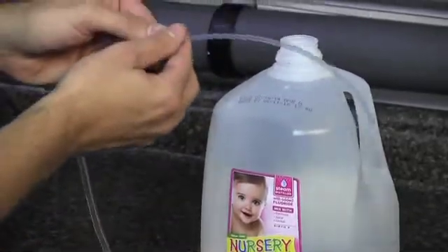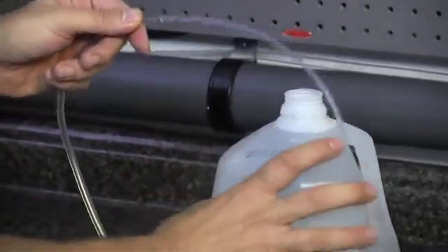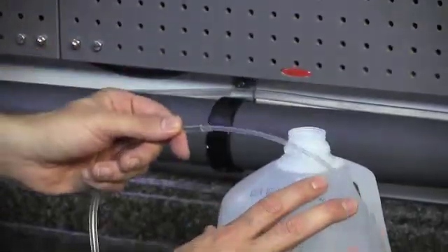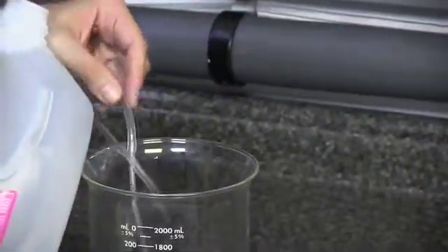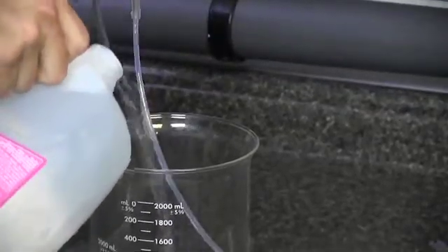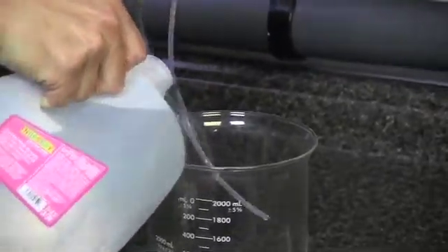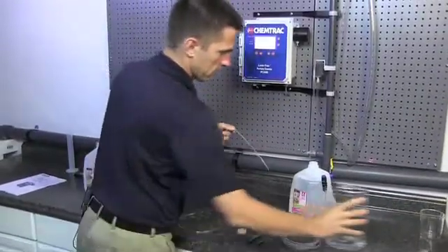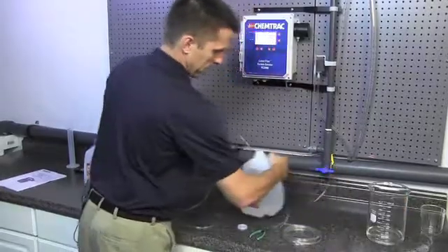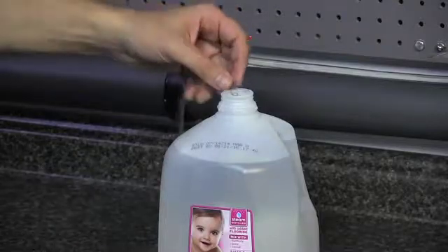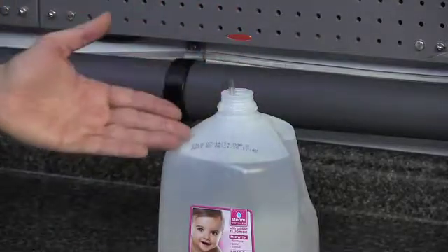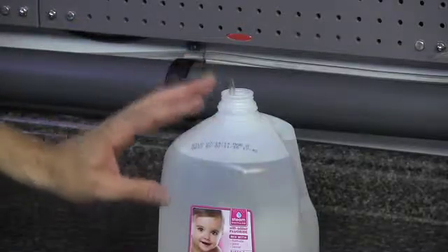Then what we're going to do is rinse this tubing off before we put it in our jug. Now this jug here we're actually going to use as our rinse water jug, meaning we're not going to add spheres to this jug. We're just going to use this to kind of clean off our tubing. Our main reason for rinsing the outside of the tubing is just a precautionary step to make sure that we don't contaminate the jug with any particles.